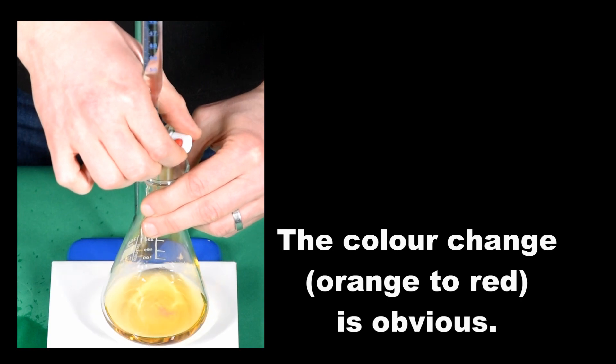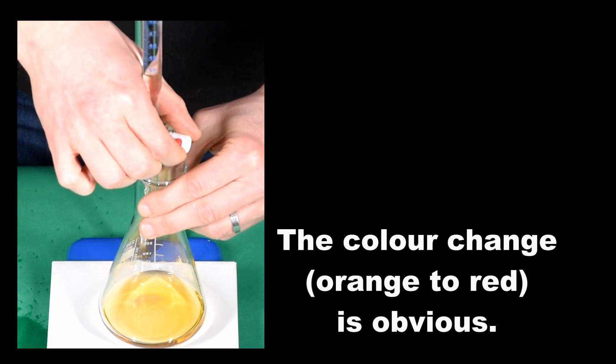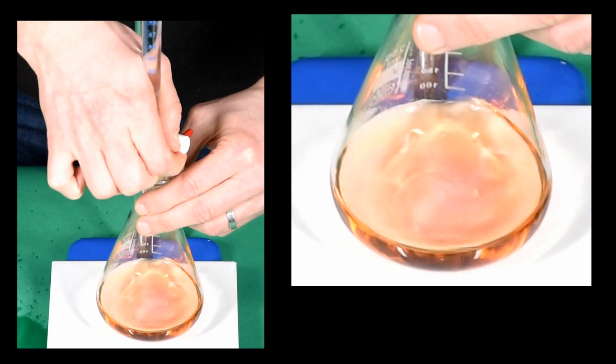Eventually, one drop changes the colour to red, and that colour remains in the conical flask.